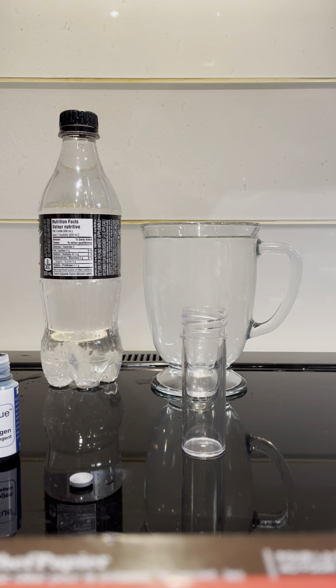Here is my H2 Blue demonstration of the Echo H2 tablets. Similar to the AlkaViva tablets, they are long expired. You can see they were manufactured May 2015, making them six years old now. This means that without stability data, they're legally expired like four years ago.